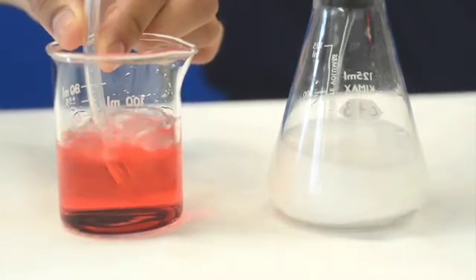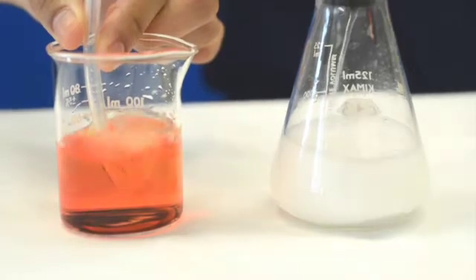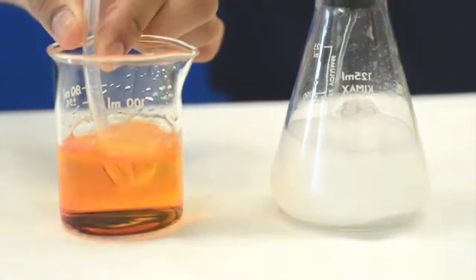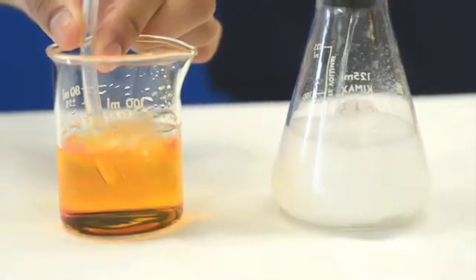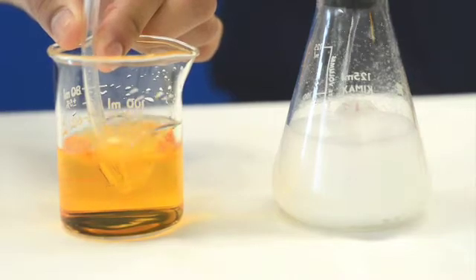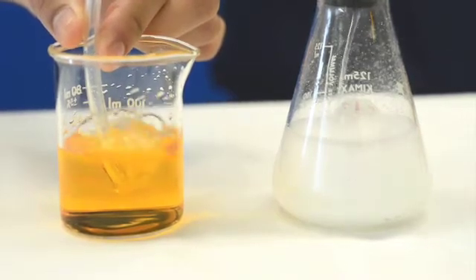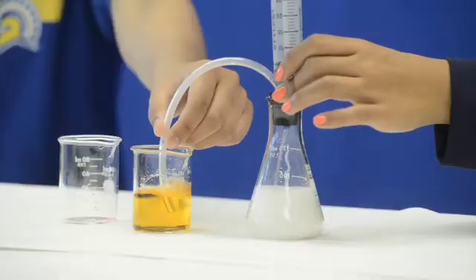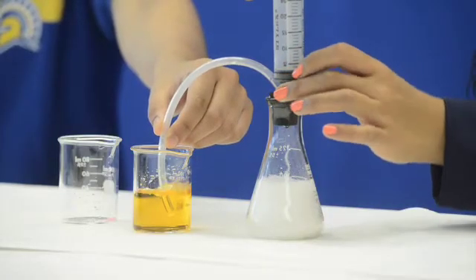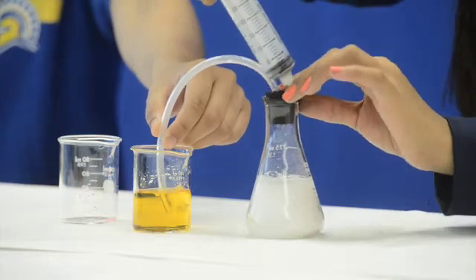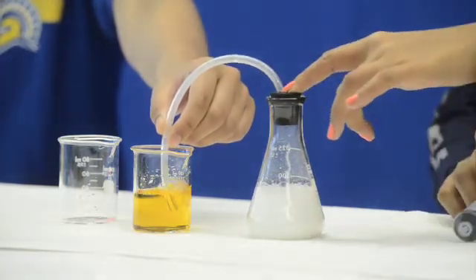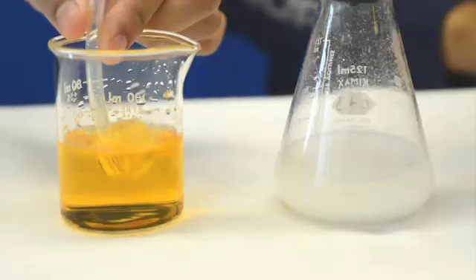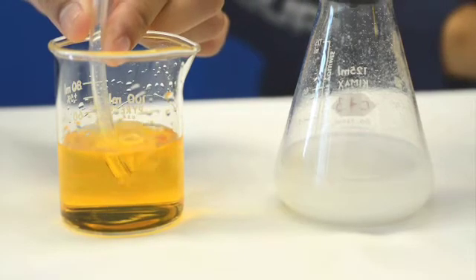By bubbling carbon dioxide through the solution, it will turn the phenol red acidic, creating the color change from red to yellow. The more acidic the phenol red, the longer it will take the Anacharis to absorb the carbon dioxide. When you're done injecting vinegar into your flask, cover that second hole so that all of your carbon dioxide goes into your beaker, and hold it there until it stops bubbling.